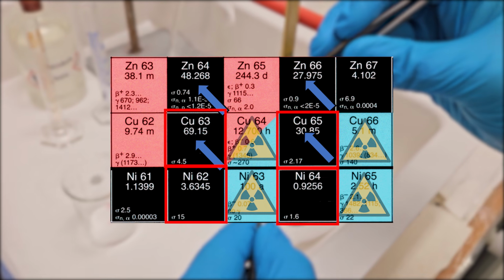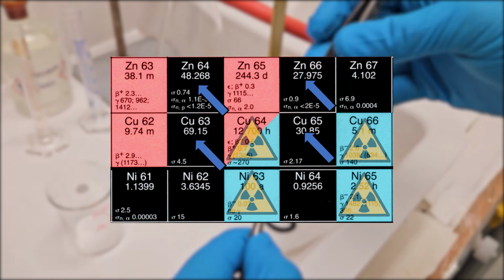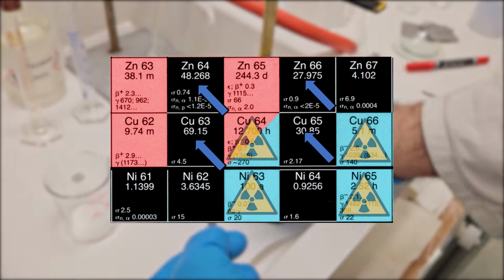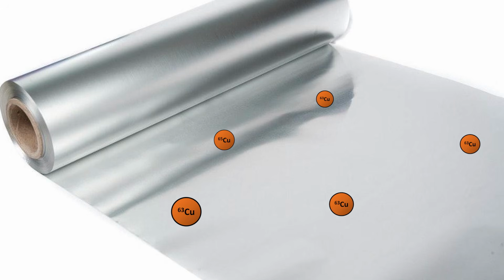So, in some cases, this isotope is then radioactive and in the best case scenario decays via beta minus with gamma emission occurring pretty much simultaneously. This can be measured to determine how much of the substance under investigation was present in the sample. To illustrate the operating principle a bit more vividly, from the previously tiny silent traces of copper in the aluminium foil, we create loudly screaming radioactive copper isotopes which suddenly make themselves known through the gamma radiation.